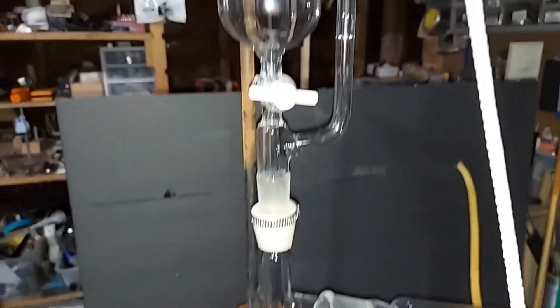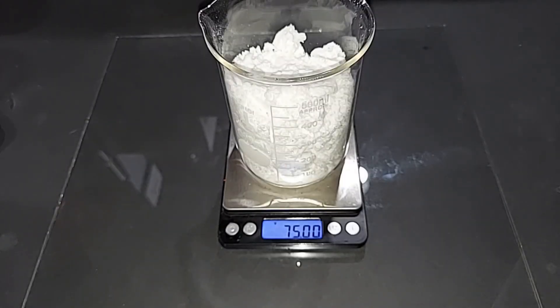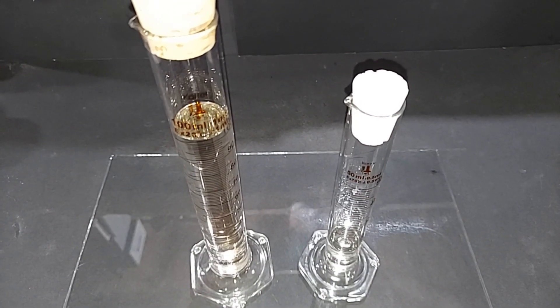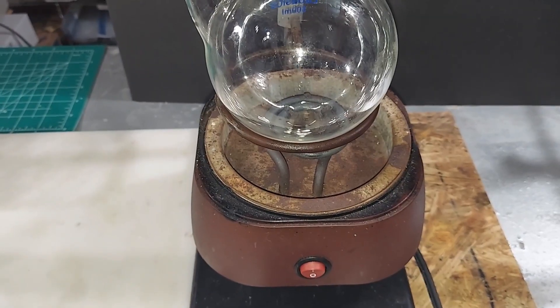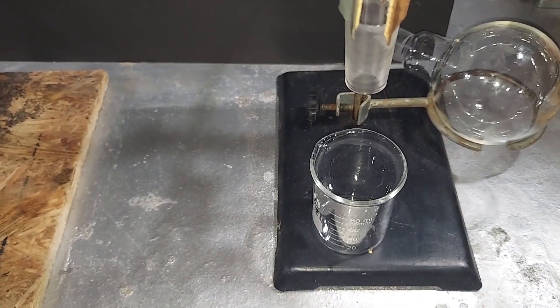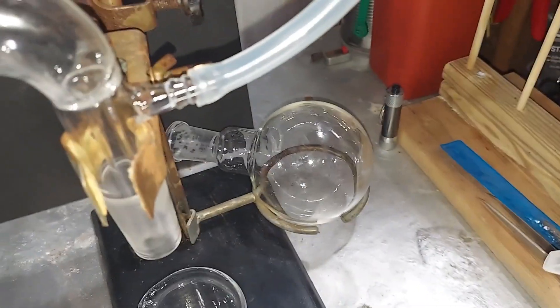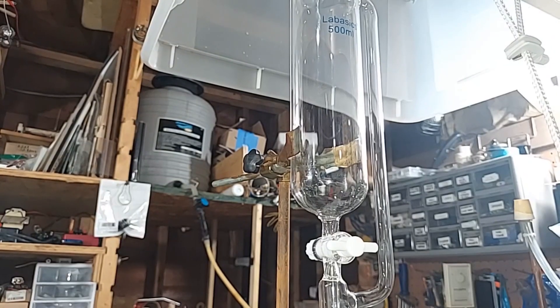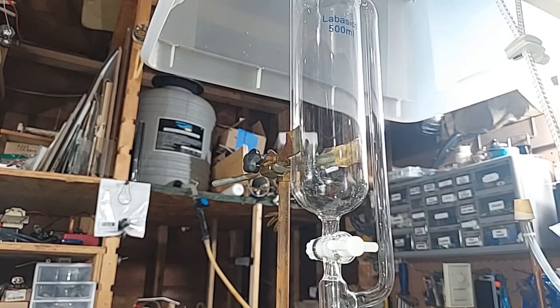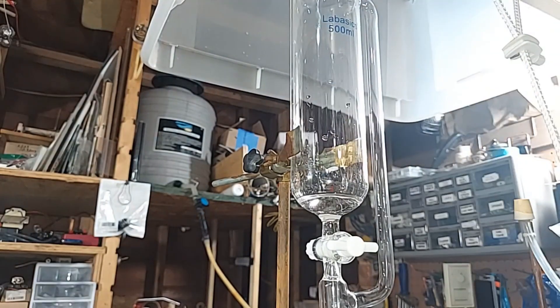I'm putting in 75 grams of anhydrous sodium acetate, pre-weighed, and 113 milliliters of concentrated sulfuric acid pre-measured — 100 mL there and 13 mL there. Everything is set up: anhydrous sodium acetate in the flask, sulfuric acid in the addition funnel, and a 100 mL beaker to collect everything up to 115°C, at which point I'll swap it for a 250 mL round bottom flask. I'm adding the 13 mL portion first, then the 100.